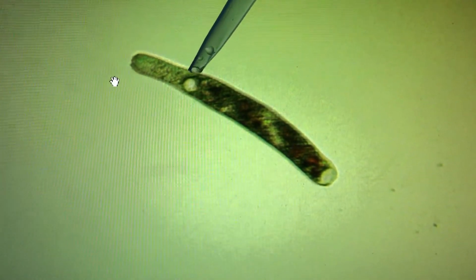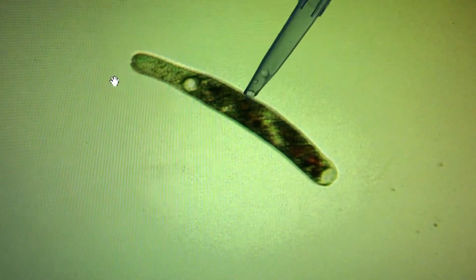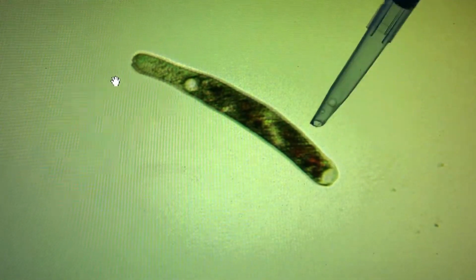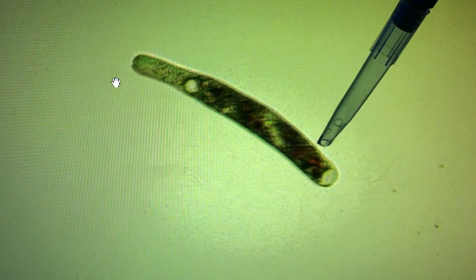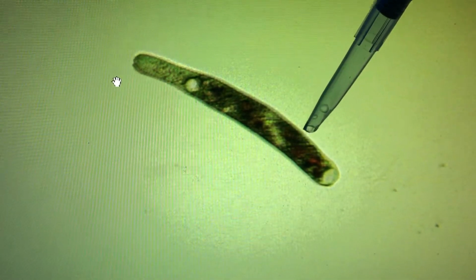They basically consume coral tissue and zooxanthella. This here is a vacuole, which is a cytoplasmic organelle that stores things. You can see here are zooxanthella that have been eaten, and here are zooxanthella moving towards where it excretes waste through another vacuole at the back end. And these zooxanthella are in the process of being broken down. They're digesting, and you can see they're turning a reddish color.